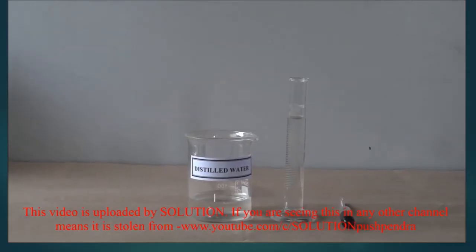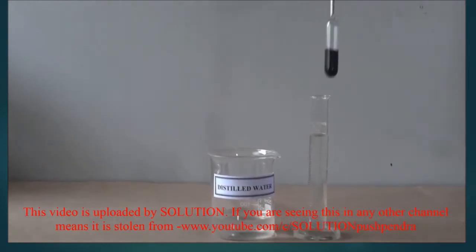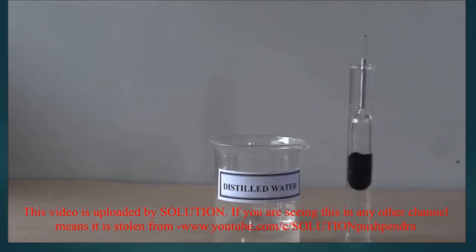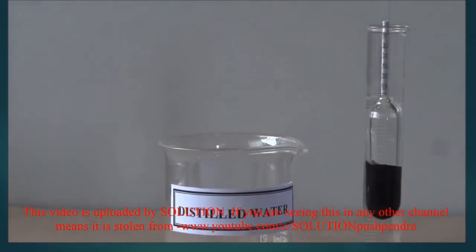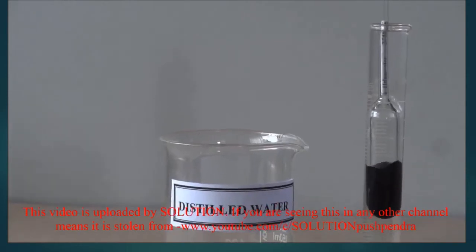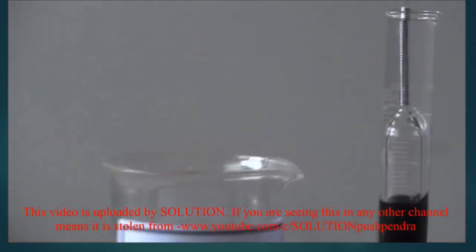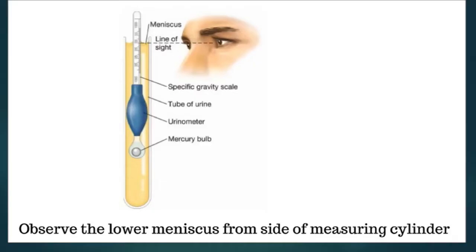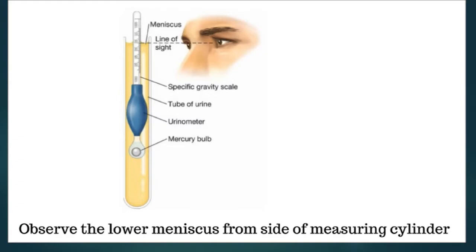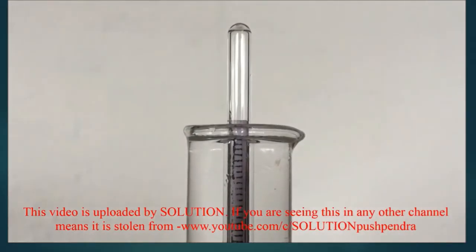We have taken a urinometer and, with a slight rotation, introduce it into the 25 ml of water in the measuring cylinder. Care should be taken that the urinometer should not touch or adhere to the wall of the measuring cylinder. After a short time, take the reading at the lower meniscus from the side of the measuring cylinder and note it down.